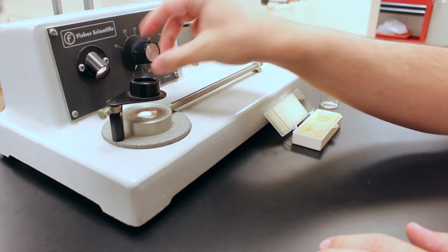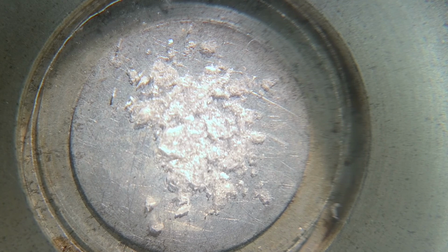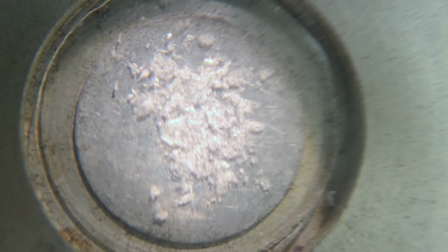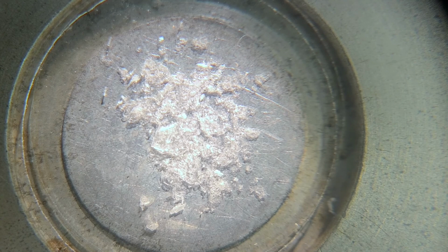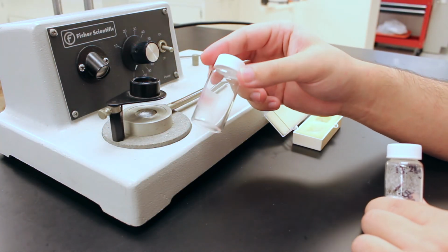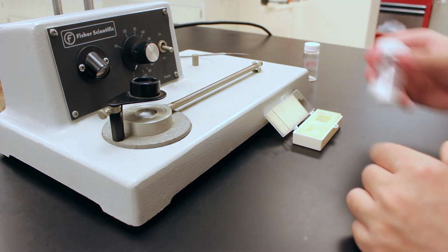So you increase the temperature, and the trick here is to do it very slowly, because you can easily overshoot the temperature. So I'm not very good at it, but some people are, and they can get it very close to the melting point. So that's how we prepare the sample, and I'll do the same thing for this crude sample. I just won't show it. So the next shot will be of us looking at the crystals through the magnifying glass.